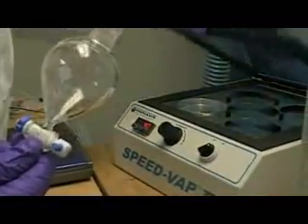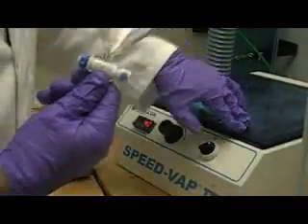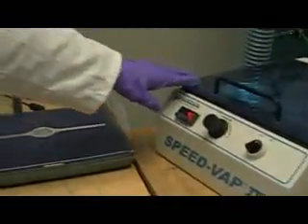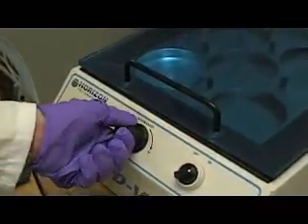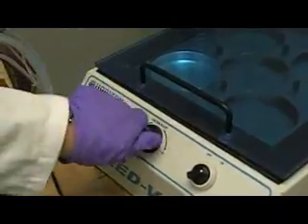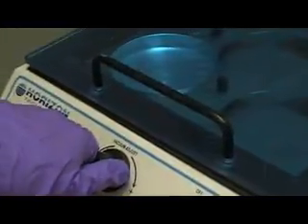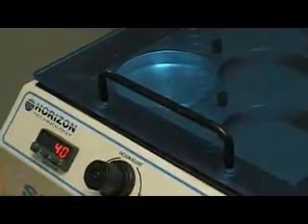I close the lid of my Speed-Vap, putting a little bit of pressure on the seal to pull a vacuum. And what you can see is a Venturi effect now on the hexane vessel itself. And you have to be very careful when you pour it to make sure that it does not bubble over, that you just see a small disturbance in the surface of the liquid. If you see bubbles and splashing, you will lose some of the compounds of interest. So normally you'll see sort of a stirring and an eddy created in the liquid.